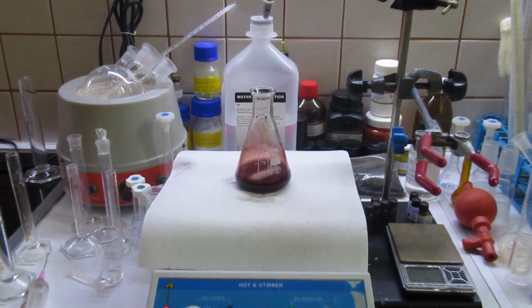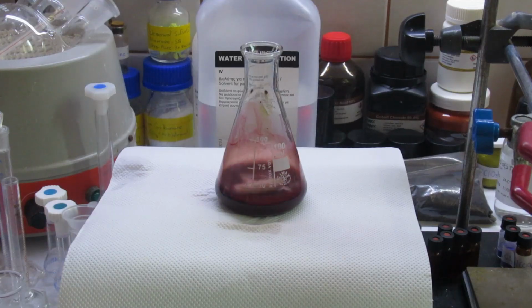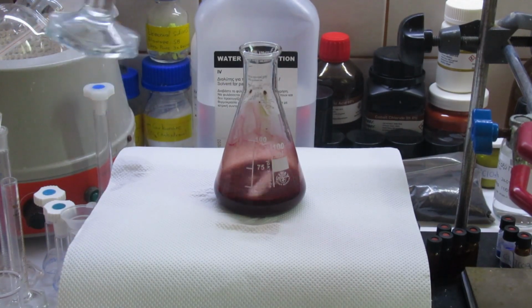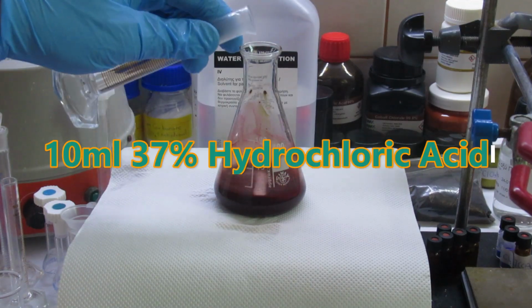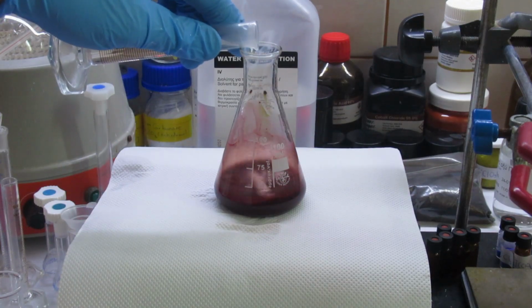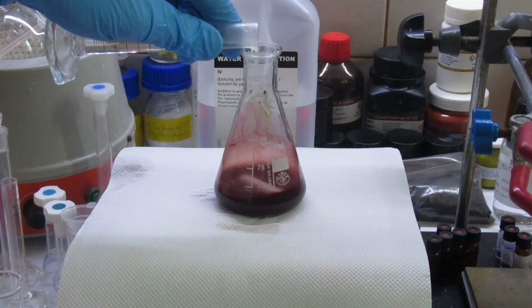And so this is the final stage of the reaction. We actually precipitate the complex, we acidify the mixture with 10 milliliters of concentrated 37% hydrochloric acid. The fumes that you see are ammonium chloride, it's nothing to be worried about.